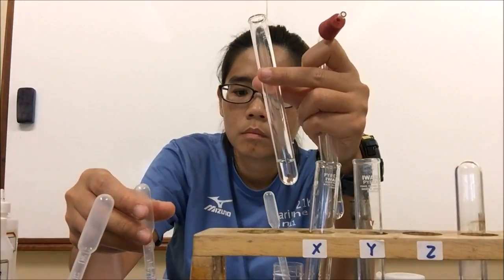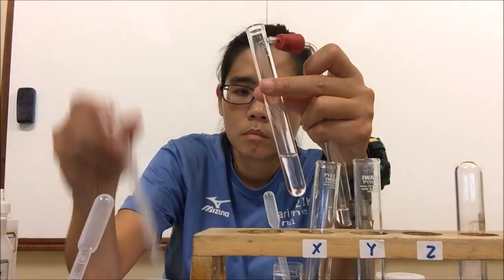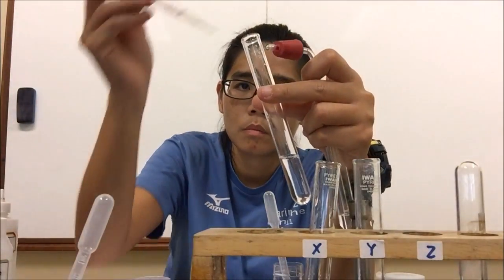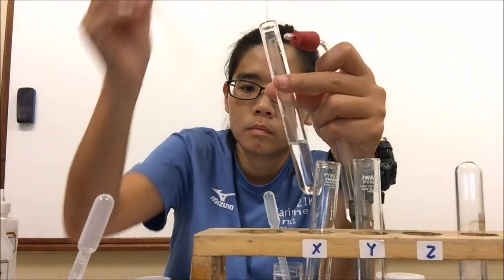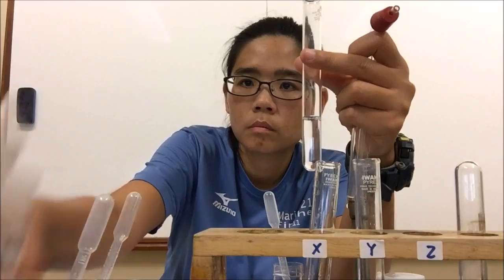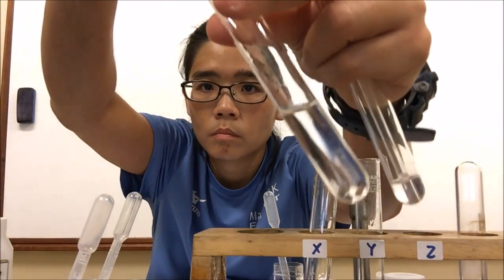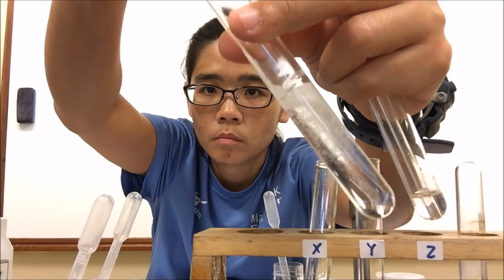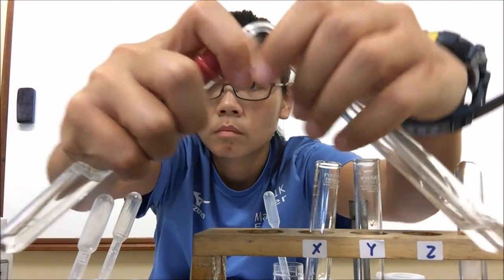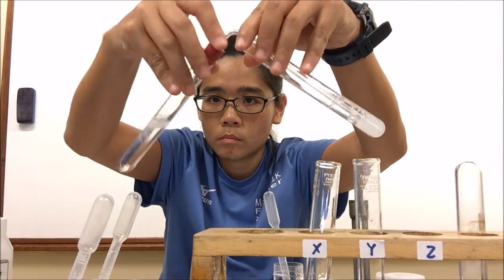It is important to prepare the lime water first so that the gas will not escape. As soon as you add the nitric acid, you get bubbles, and you immediately connect the delivery tube since you already have the lime water ready. Shake the test tube to mix, and then you will see a white precipitate form in the lime water. We conclude that carbon dioxide was given off — Z is also a carbonate.